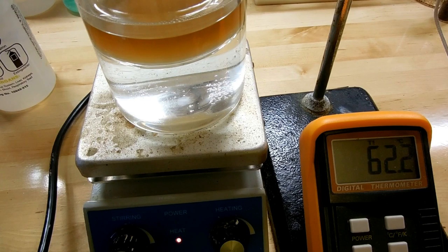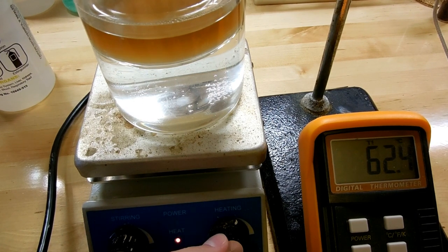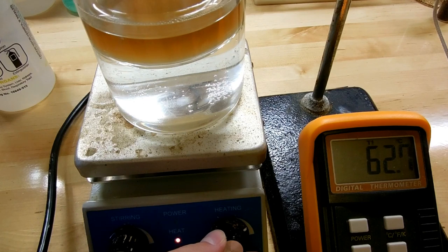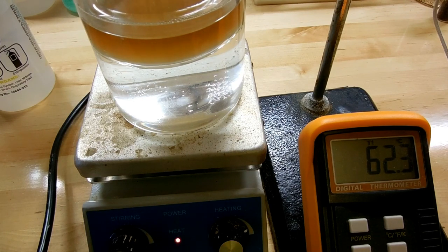I've been running this for about four hours now. I had to stop about two hours in and go to dinner and then left it overnight and came back and did another two hours today. So now I'm going to raise the heat and bring it up to about 80 or so and allow most of the methanol to vaporize.